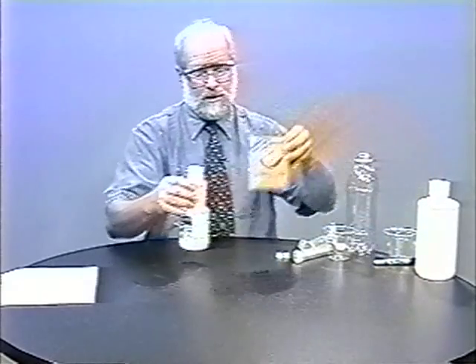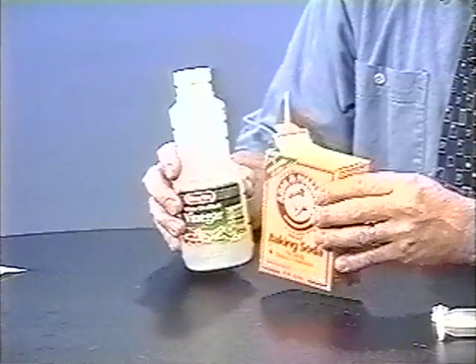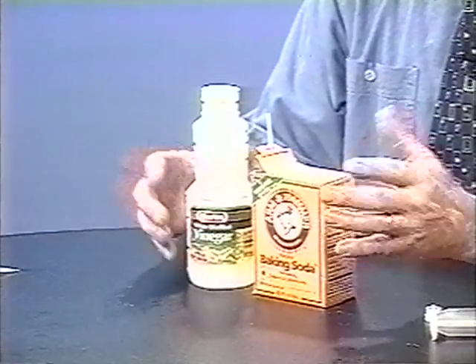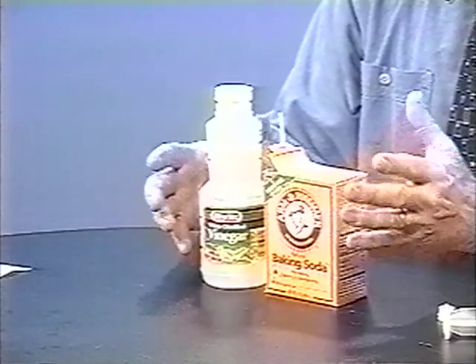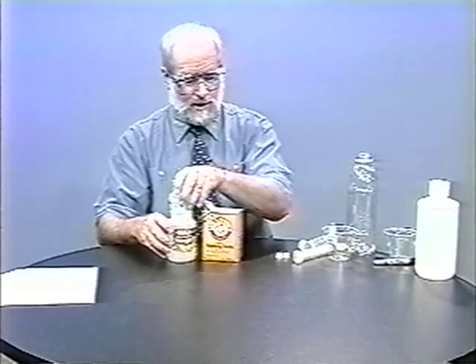I have my students start with generating carbon dioxide, and we do this using vinegar and baking soda. So if there's any problem whatsoever, the students have only been working with very simple chemicals that really couldn't cause too much damage. Okay, let's get started here.